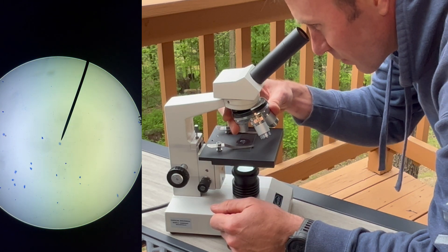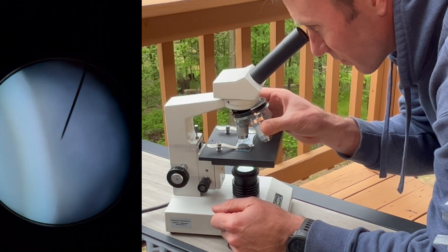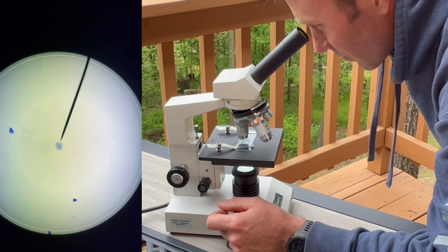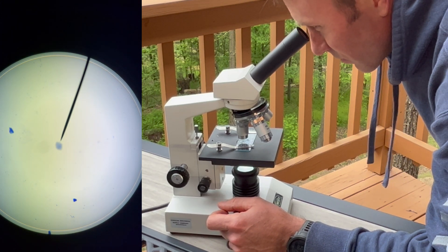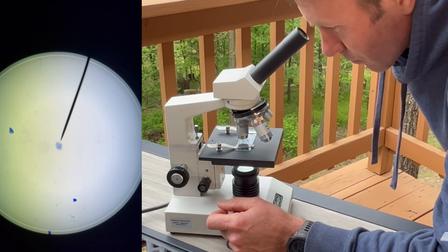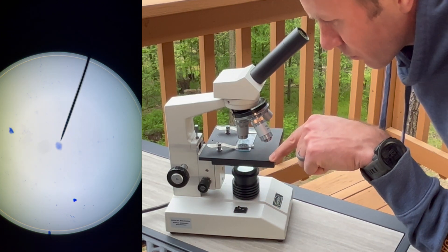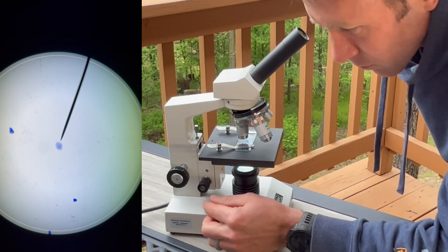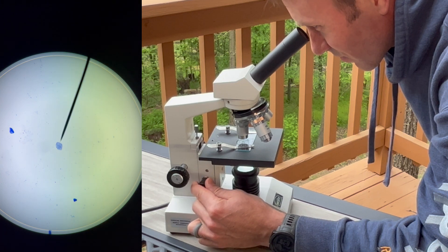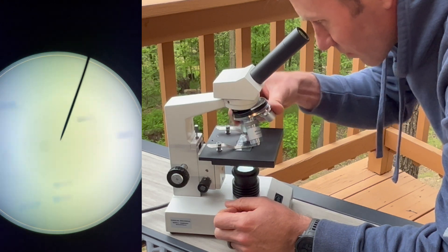Now I'm ready to turn the nosepiece to the next level of magnification. This is important: don't use the coarse adjustment knob anymore. Doing so at a higher level of magnification can actually crush the glass by forcing the larger objective lenses down into the glass. So using only the fine adjustment knob, bring your image into clear focus. Now it's time to go to the highest level of magnification.